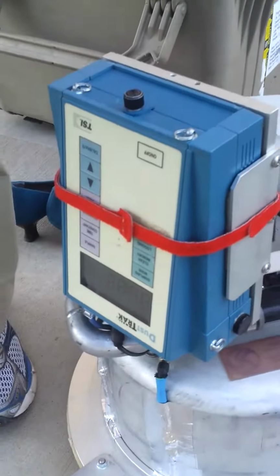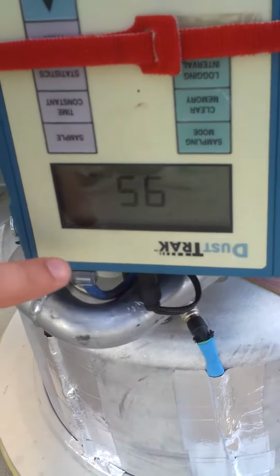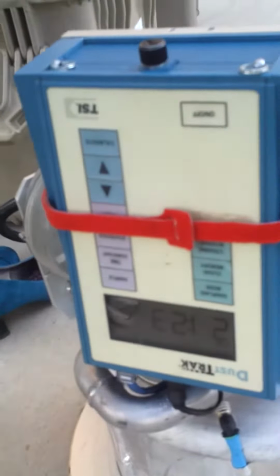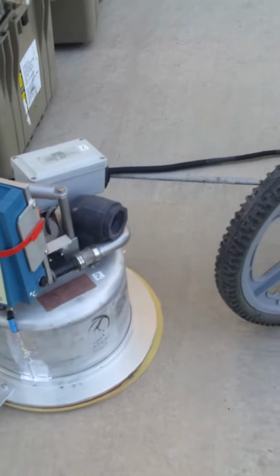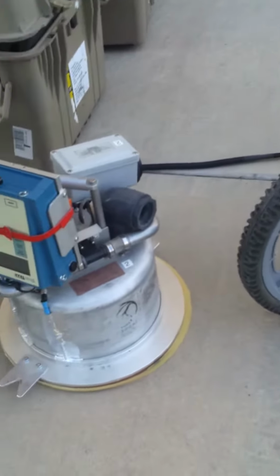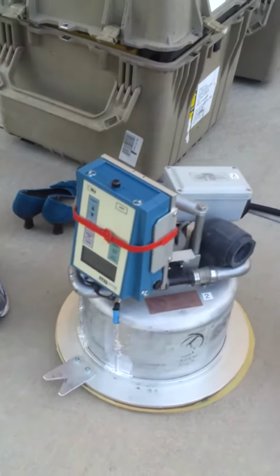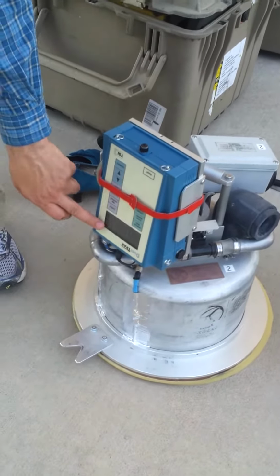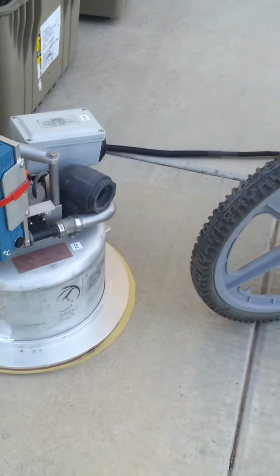So to turn it on, it's pretty easy. There's an on and off button. So you just press the on button, and then you wait for the instrument. So this 95% means that the battery is at 95% or that it has external power. Okay, see, so it showed time, but don't worry about that because all the time data is stamped by your computer time. So you kind of want to go here into this reading mode. So now it's reading the current dust concentration.